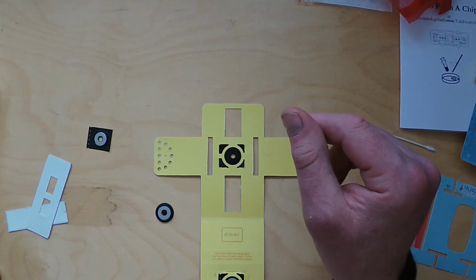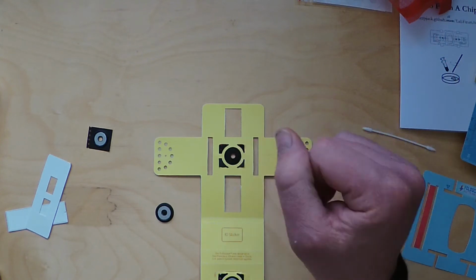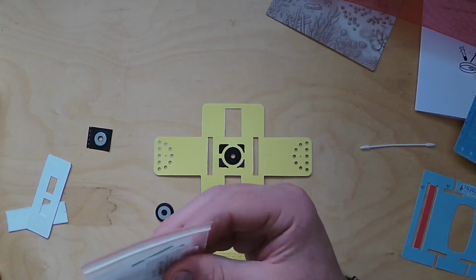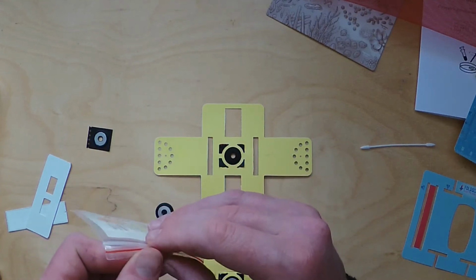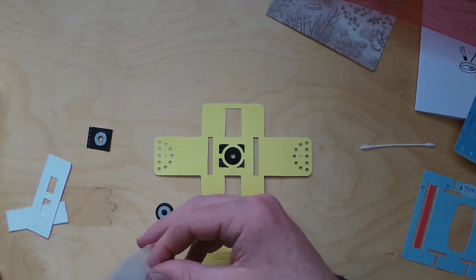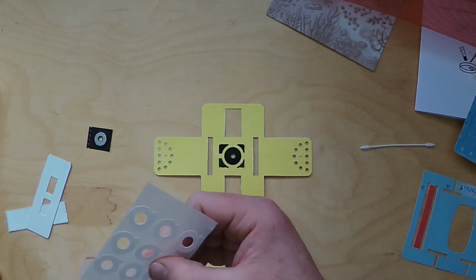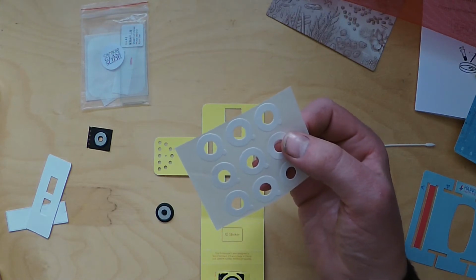What you need to do is find one of the ring stickers. So go back to your bag, and in your bag you'll find another bag inside the mesh Foldscope bag. Inside the bag that says caution glass slide, you want to open that up. You want to find these ring stickers. And these are what we use to attach the lens, but also to attach the phone later on. So this is what you need for that.